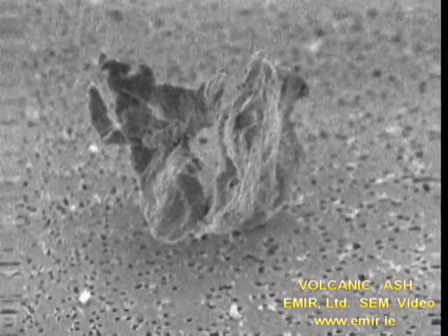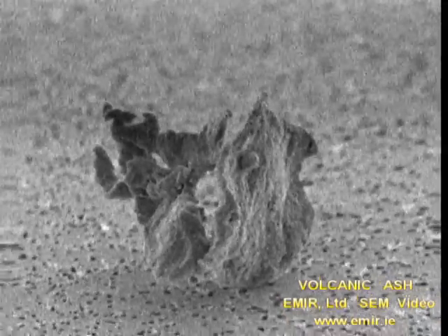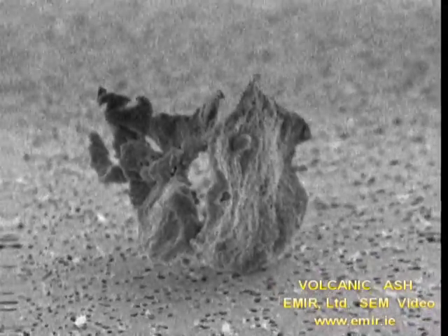This volcanic ash particle was collected by using a pump that pulled air through a polycarbonate filter that was perforated with pores that measure eight-tenths of a micrometer in diameter, and it is these pores that are visible as the small black dots that can be seen in the background.